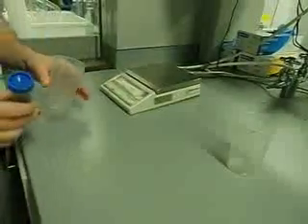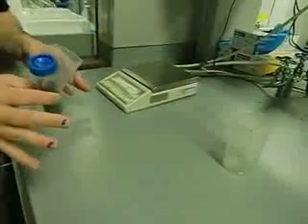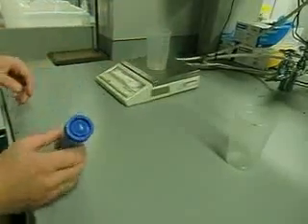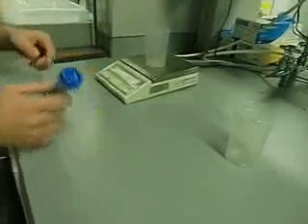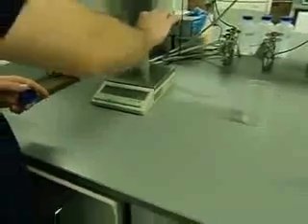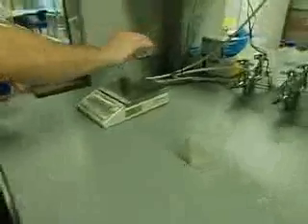So we're gonna take our first sample now, and we're gonna weigh it because we want about the same general weight. First, I'm gonna put my weighing cup here. I'm gonna zero it. Make sure you don't get the numbers. Oh, okay, I'm gonna get 10 grams.